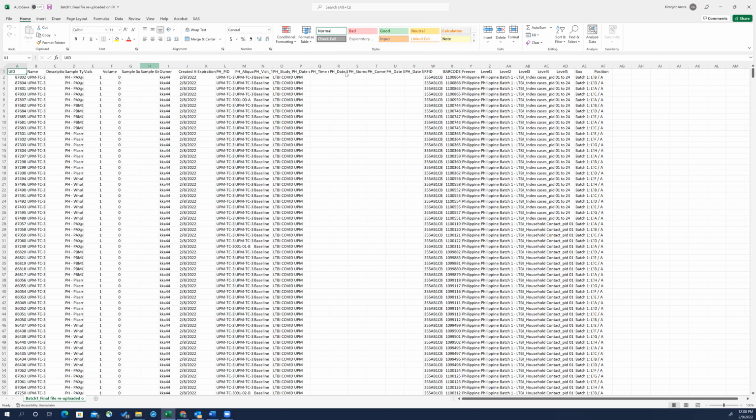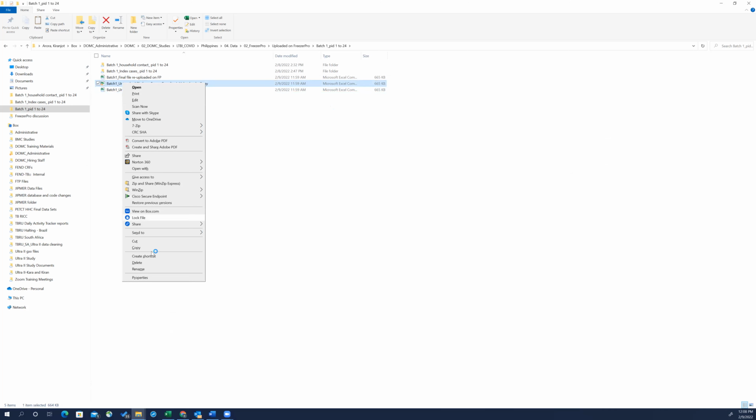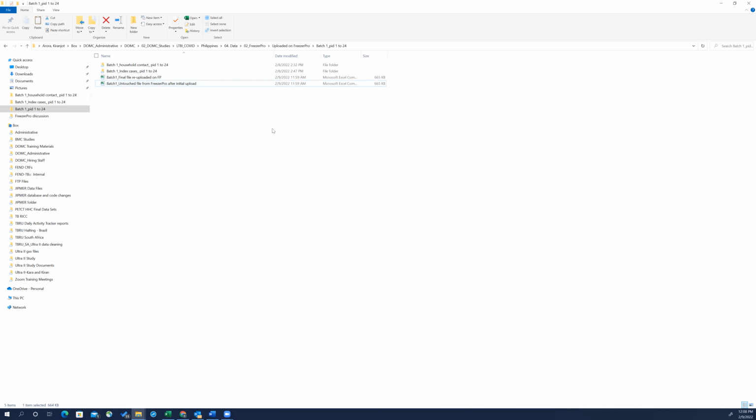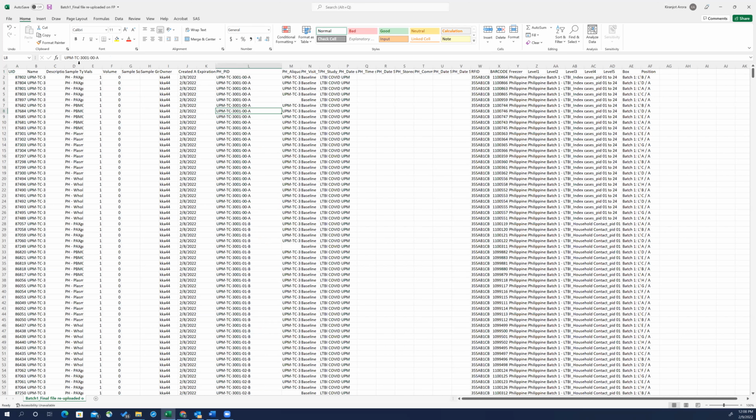All right, so basically what I did is I saved this and then I did Control C and Control V, made a copy of this and changed the name to the final re-upload. So I'll just delete this for now because we don't need a copy of that. Okay, so this is the final file. Right now it's not the final, it's the same thing, but I will be making changes on this to make it final. And the variables that I need to change are the name variable as well as the aliquot ID variable, and that is here. So column M and column B is what I want to change.